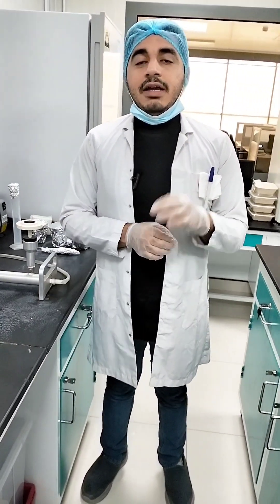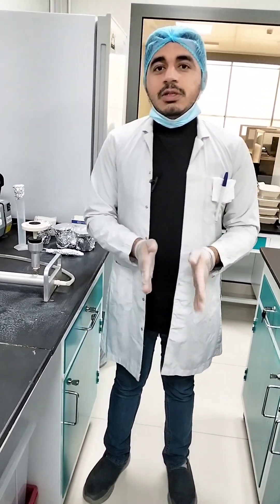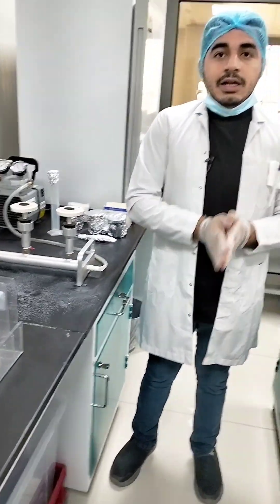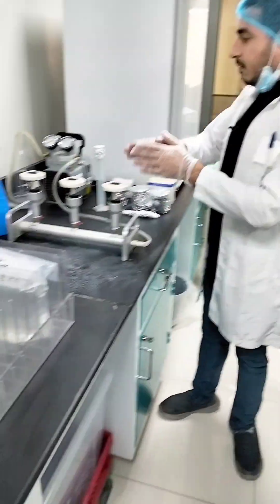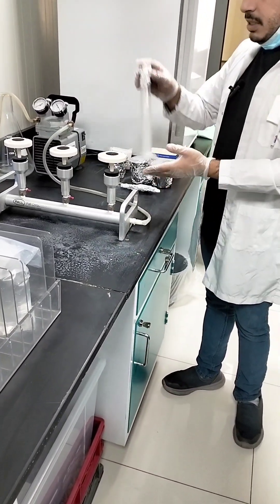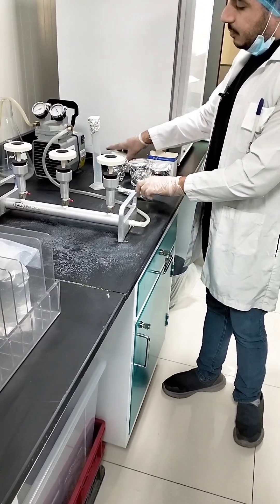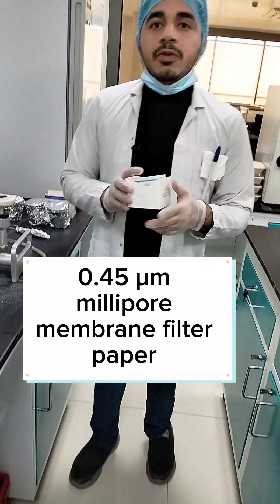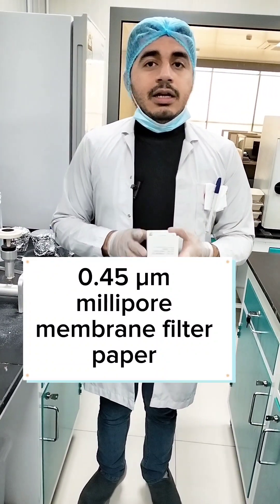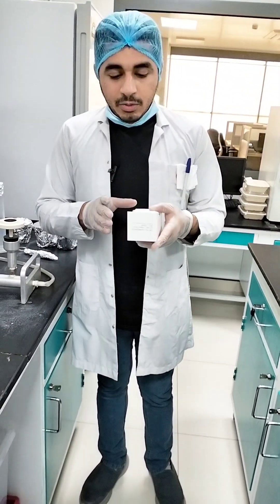Membrane filtration technique is a very common and effective way of detecting microorganisms from a water sample. For this procedure I need a water filtration assembly, apparatus like a measuring cylinder, forceps, filter membrane, a 0.45 micrometer membrane filter paper, and a biosafety cabinet and incubator for the final incubation.